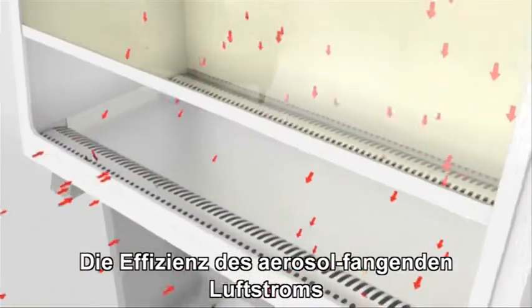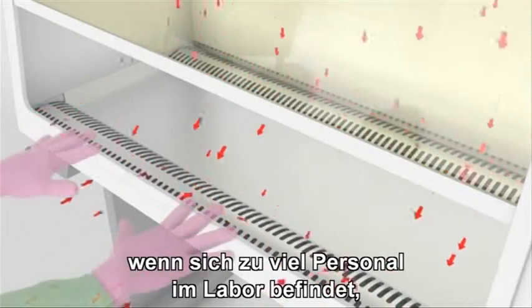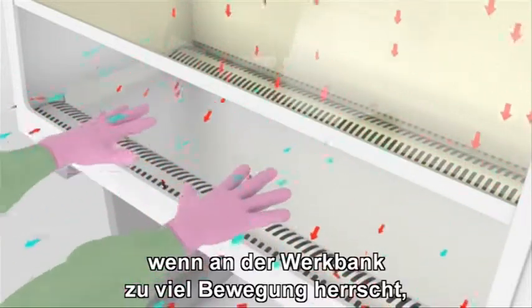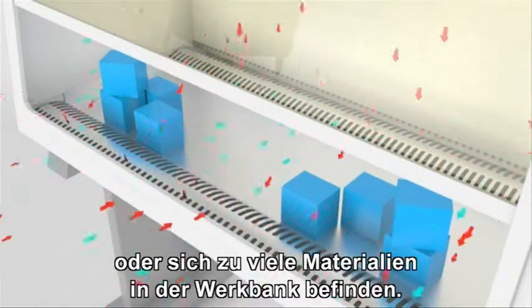But the efficiency of the cabinet airflow can be compromised by other factors such as overcrowding in the lab, rapid movement around the cabinet, open doors and windows, and overcrowding in the cabinet.